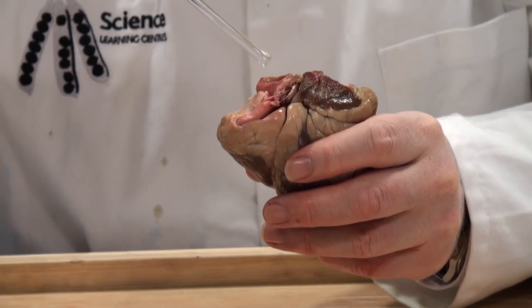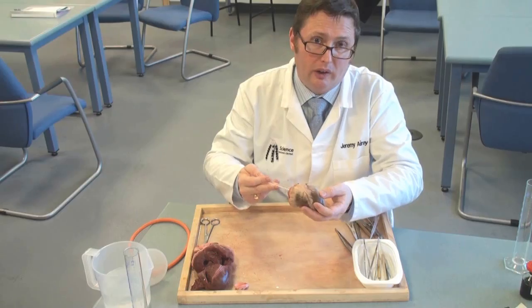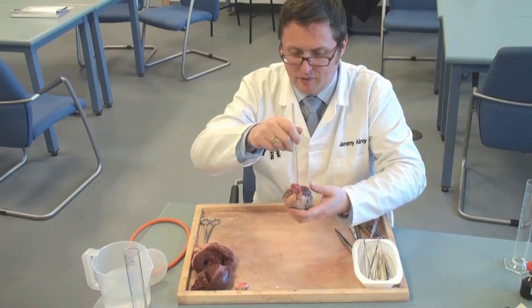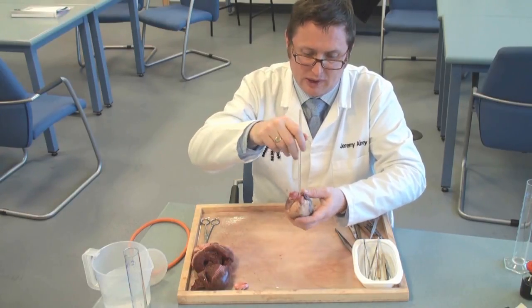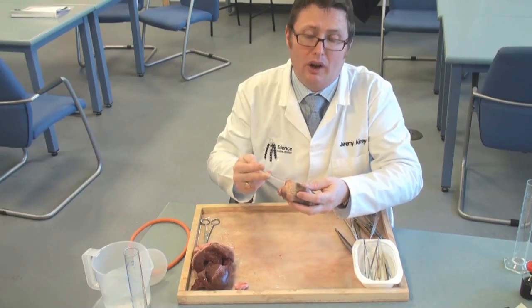If I go down the aorta here in the middle I find myself on the left-hand side, and if I go down the other artery — the pulmonary artery — I find myself in the much thinner right-hand side.